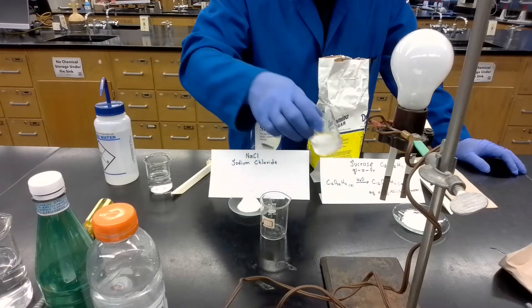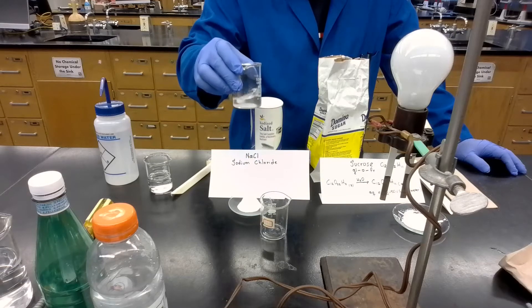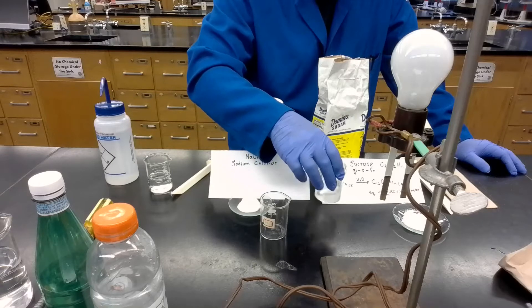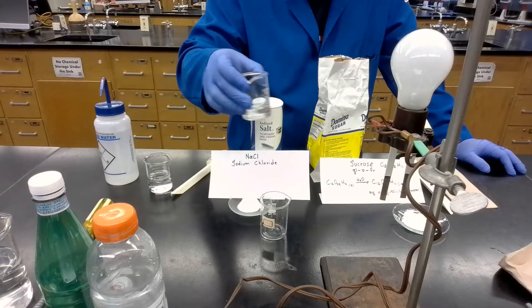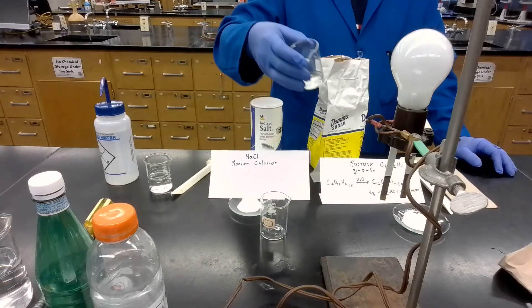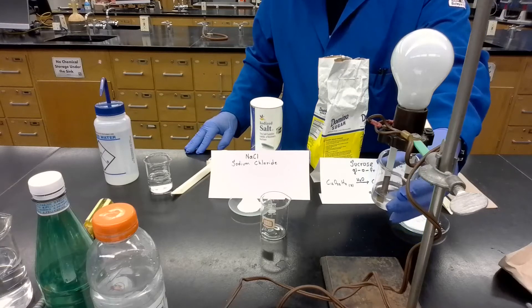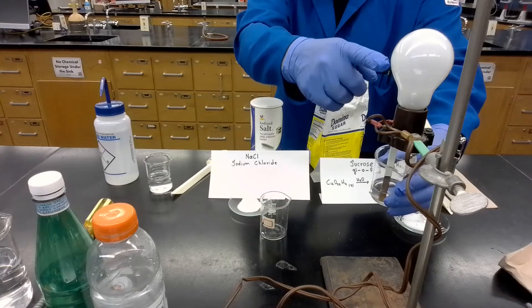Next, my first solution will be the one that contains sugar. About half of the solid sugar is already dissolved in the water — that should be enough to do the test. More sugar has been dissolved into the water. Now let's test if there's any conductivity through the solution. We see nothing here. No light is coming on.